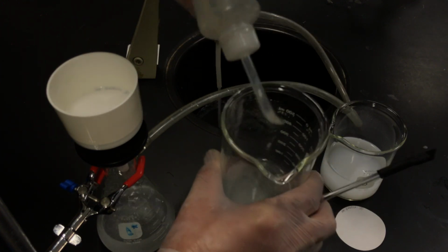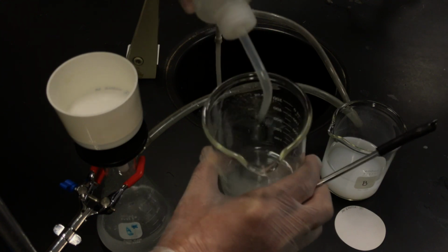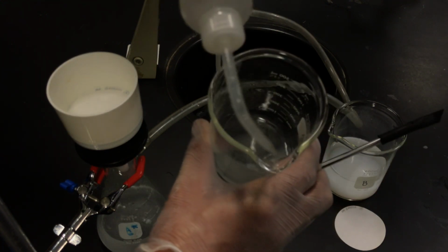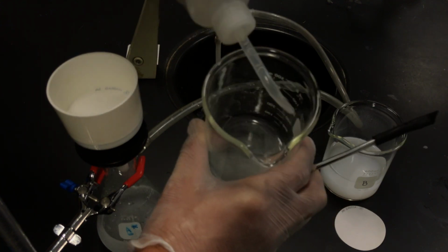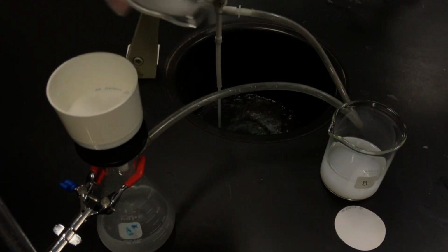Remember, this is my data. This is precipitates. We're going to use the calcium carbonate, essentially chalk, right? Precipitate, that's the part of the lab that I need. I need to know how many moles of precipitate.